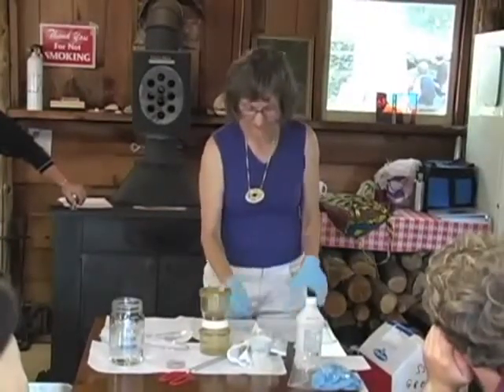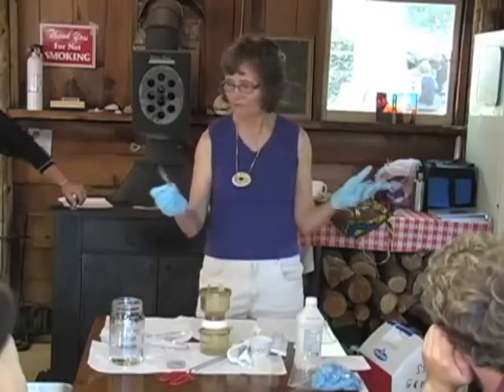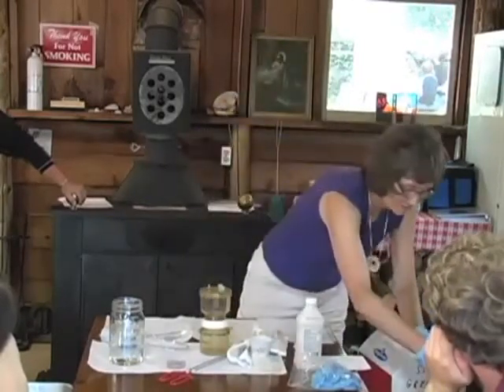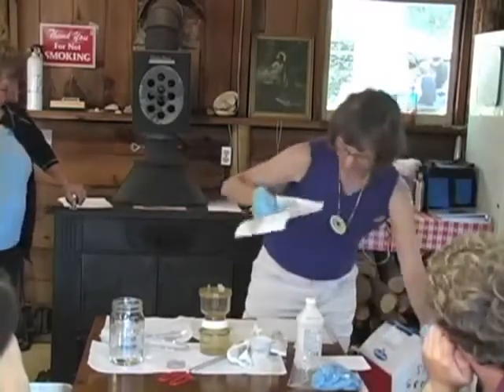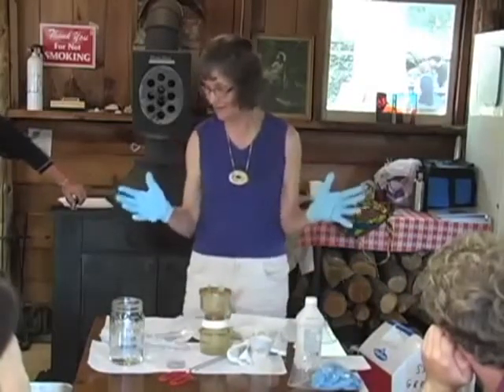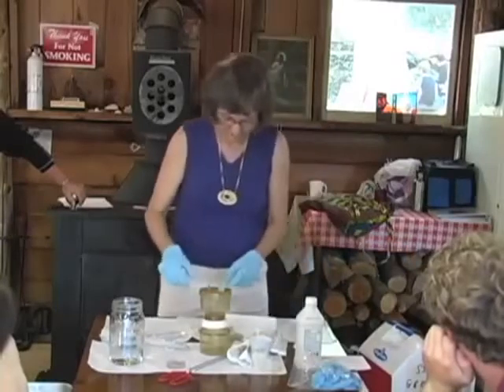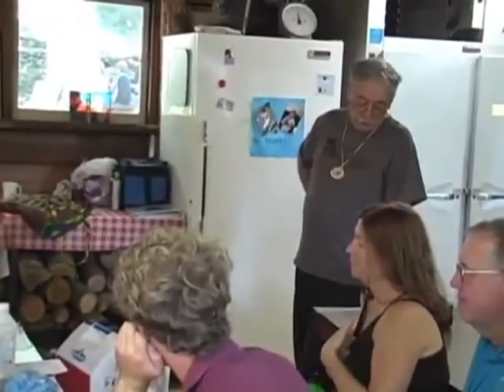Okay, so this is when you start realizing, just like what Lori's been teaching us, everything is germy. I can't set this down anywhere, literally. I'll use an inside paper towel here and hope that it's okay, but really, I have to set it somewhere. Everything in the world has germs or bacteria on it. Okay, go ahead, David. Unscrew the sterilized top half of the filtration system.